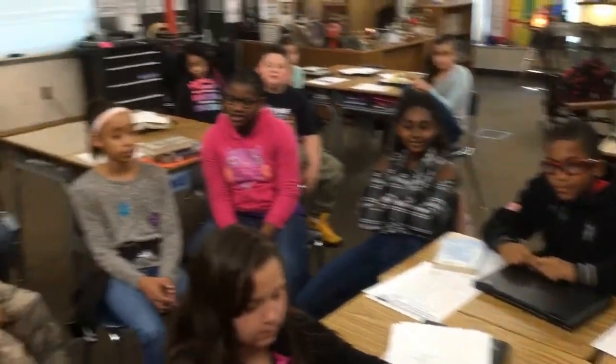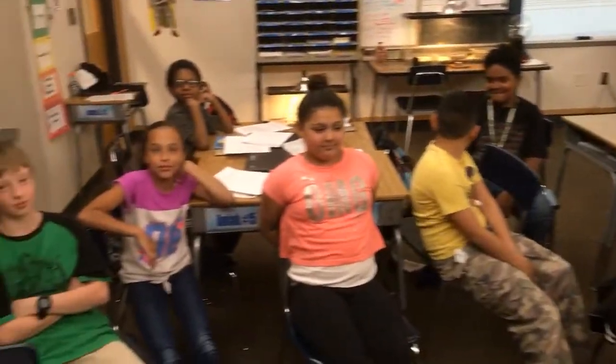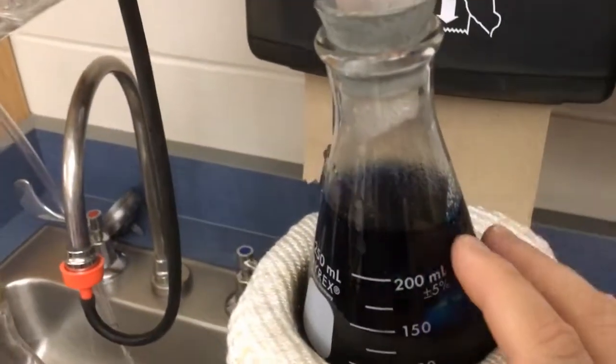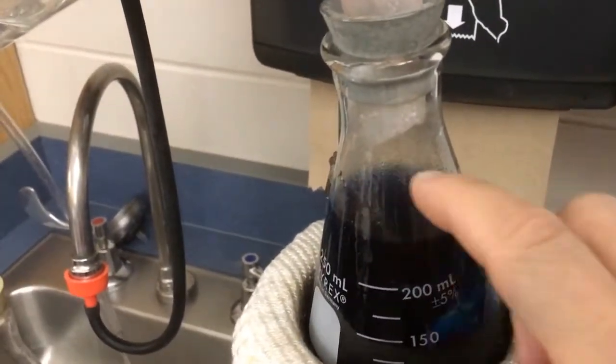But more importantly, fourth graders want to understand how distillation is a way to mimic nature's water cycle. So if I asked you, Pooja, how is this hot pad like the water cycle in nature? What's it similar to? This heat. The sun, that's right. And so the sun gets water hot. And this water in this first flask, I can see it's starting to get hot. I can see some steam building up.